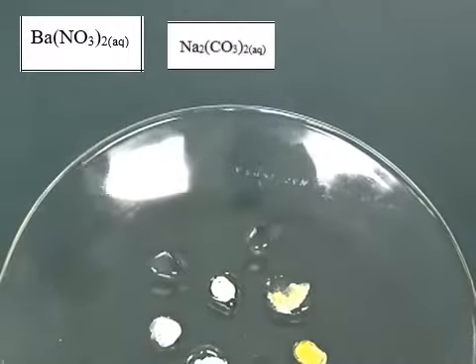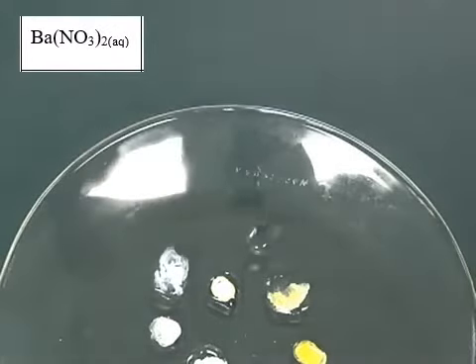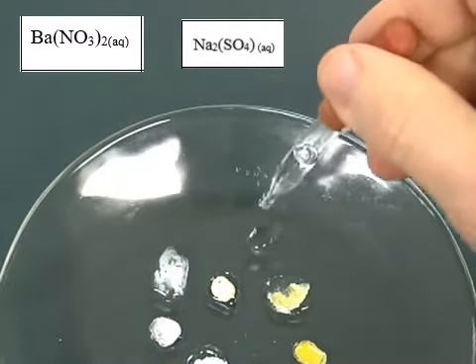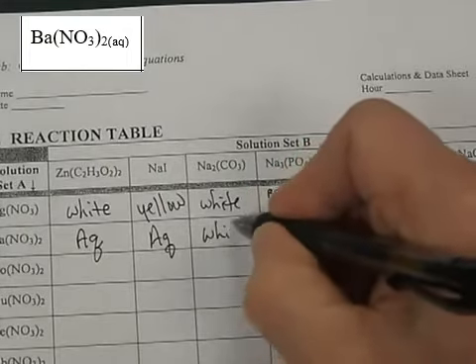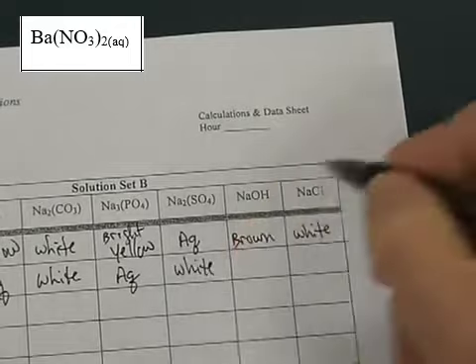I need to get out sodium carbonate. We get a white precipitate for sodium carbonate. Sodium sulfate, Na2SO4, put a drop here, a white precipitate formed there. So we go to our chart, barium with sodium carbonate, we got a white precipitate. It's a solid inside a liquid. Sodium sulfate, we also got a white precipitate.